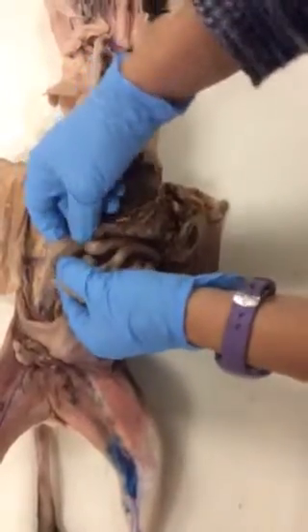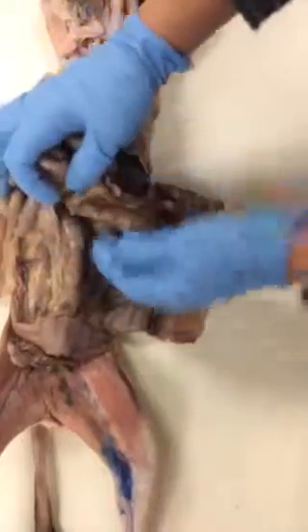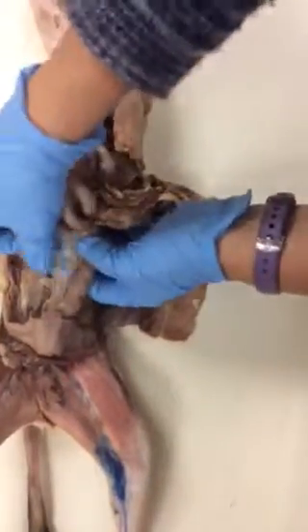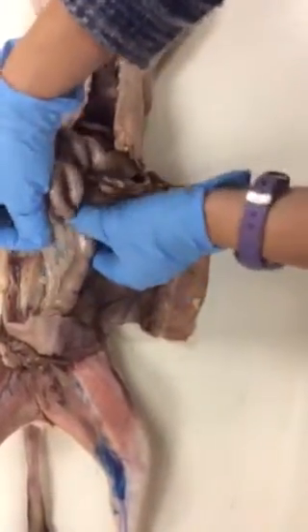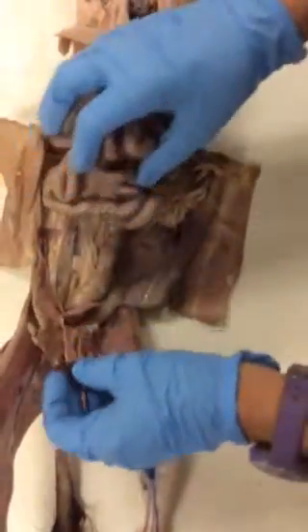The ileocecal valve is right here. And then we have the colon going around. It's not quite as quadratic as the human one. This is the mesocolon. And then here we have the colon going down. If you think about the rectum, it would be deep down here, inside already of this part.